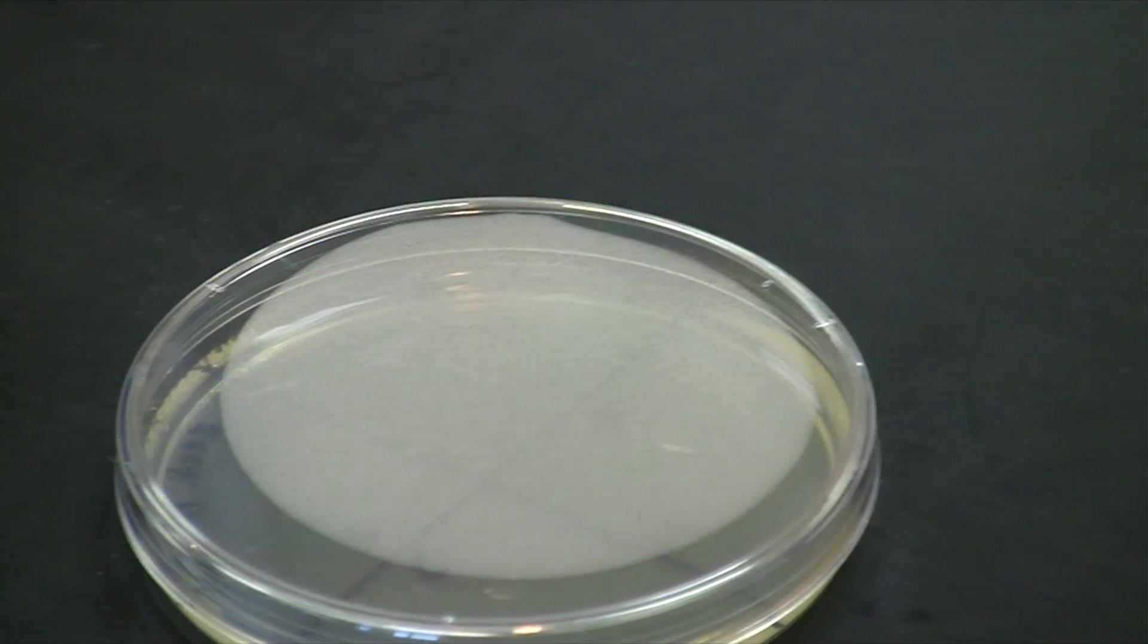Now you're all set. Go ahead and allow your plate to dry, allow the spots to absorb, and you can invert it and incubate it.